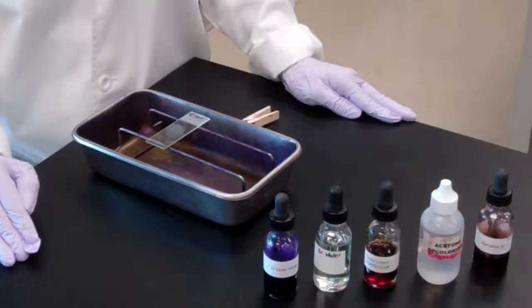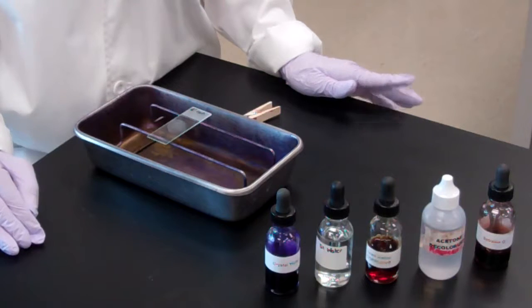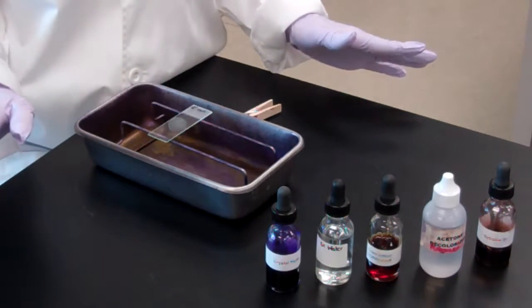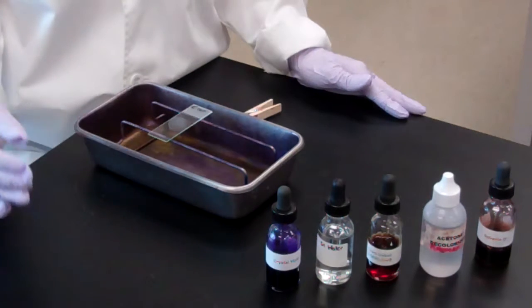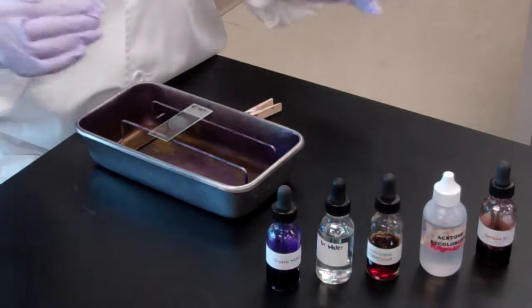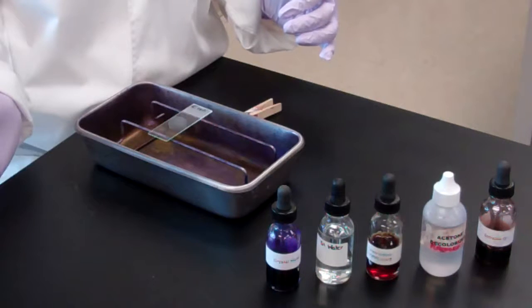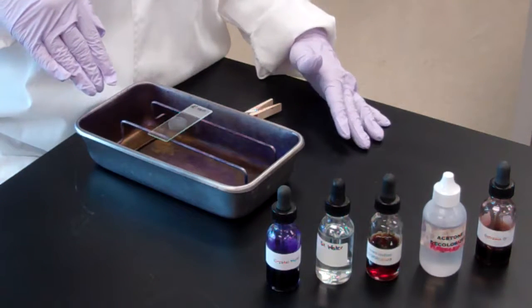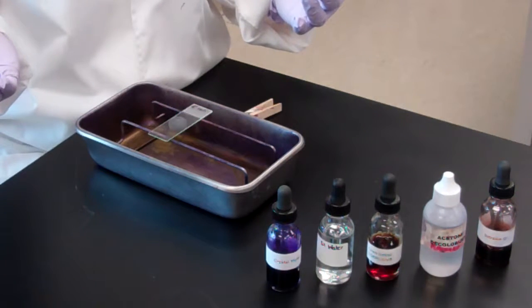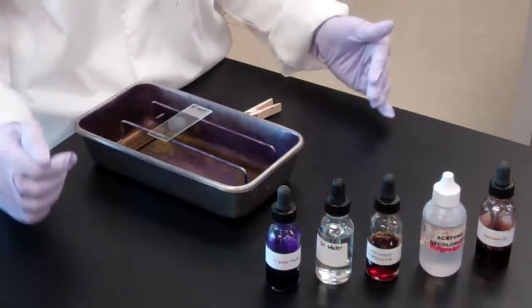This video demonstration is case study exercise number 9, differential staining: the Gram stain. The Gram stain is really the most important stain that is going to be used in a clinical laboratory setting. Our goal is to distinguish between a gram-positive organism and a gram-negative organism. This is performed when, say, you have a client that has cerebral spinal fluid removed. They're going to immediately do a Gram stain to try to determine which bacteria it is.